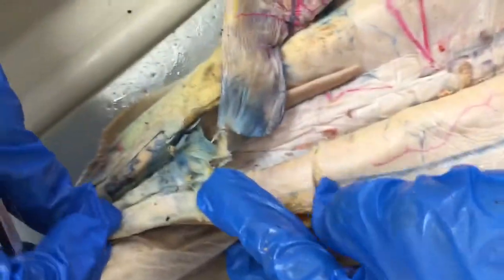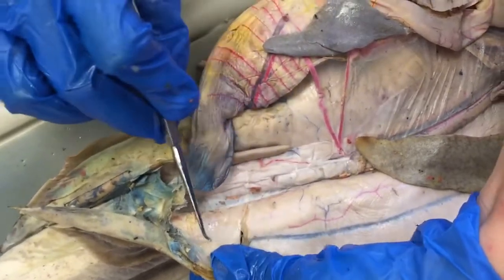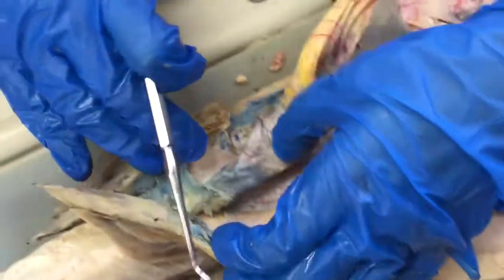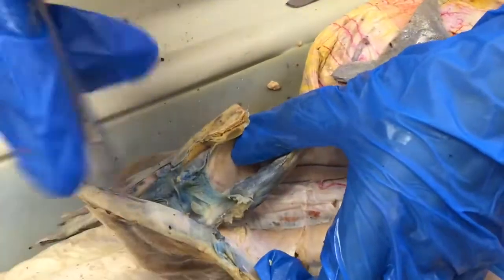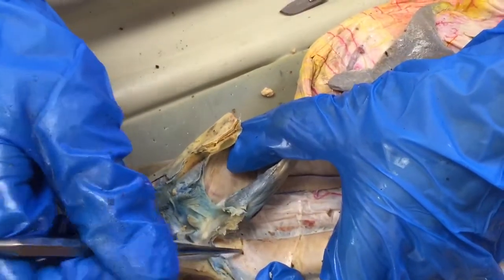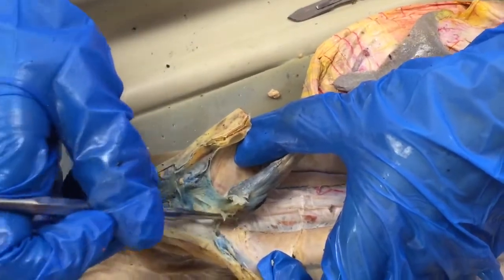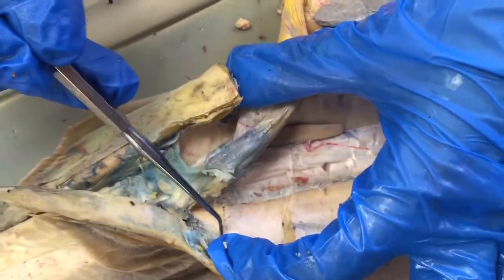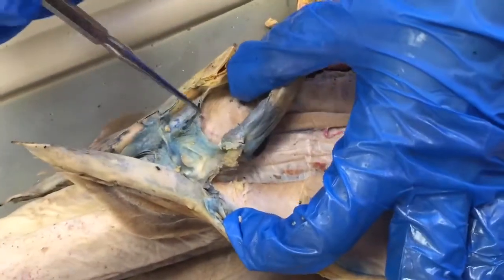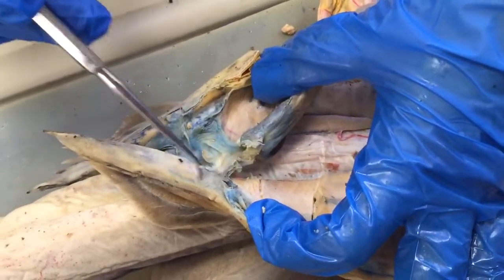Some of the last ones: on the actual body wall in front of the pelvic fin is the posterior epigastric artery. Then on either side just around the rectum area, there will be a medial branch going in — that's the iliac artery. If the posterior epigastric artery continued down towards the fins after the iliac artery branch, it would be called the femoral artery.